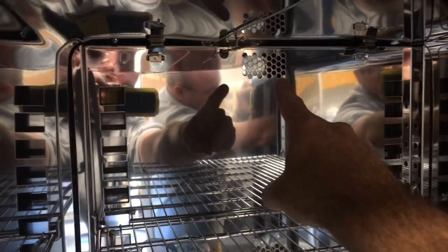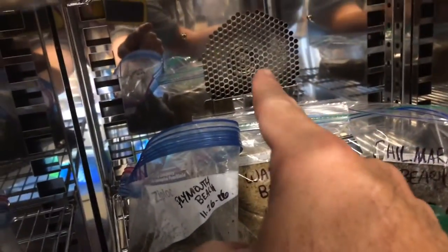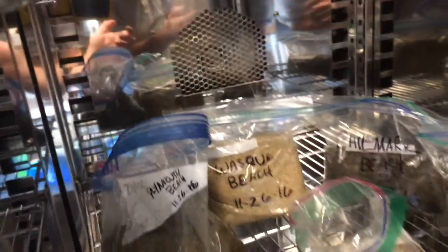In this case, the sensor — this is the way we're measuring how hot it is in here. This is the evacuation area where hot, moist air is going to leave. The source of the hot air entering the chamber is there.